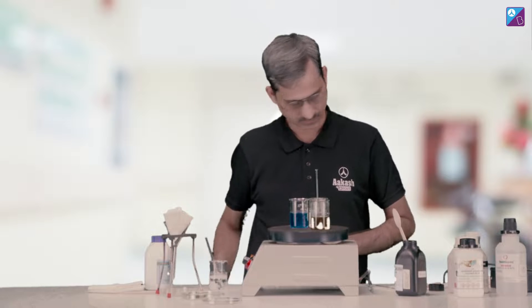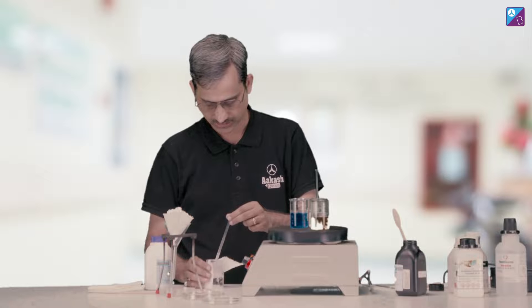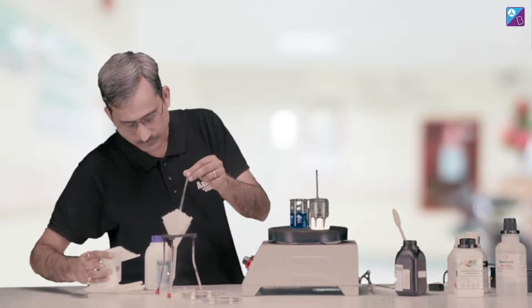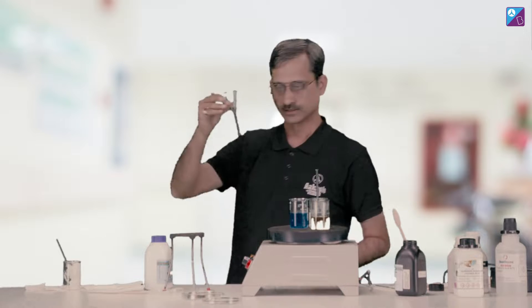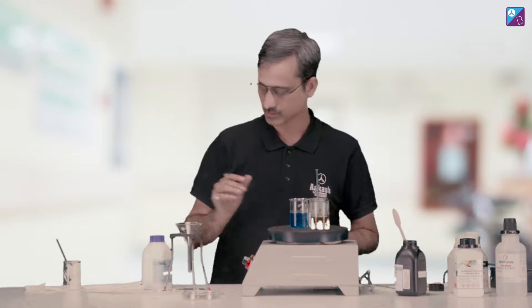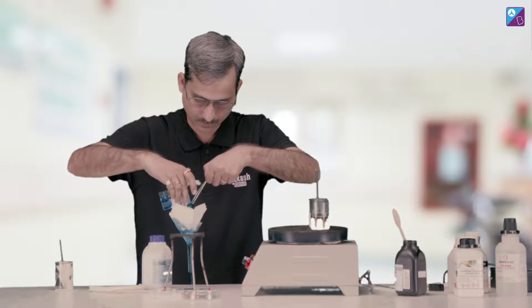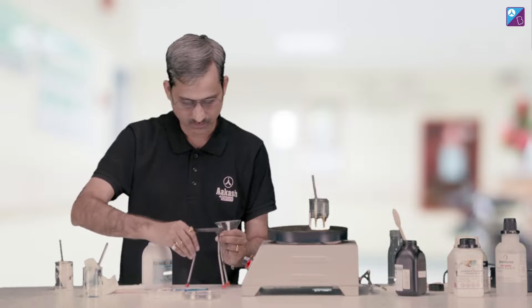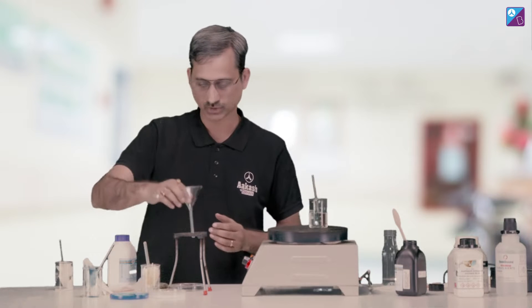To begin with, the benzoic acid — we need to be very fast with benzoic acid because it immediately crystallizes. The benzoic acid is already crystallized. Next, we take the copper sulfate. Next, we take the Mohr salt. And last but not least, is potash alum.